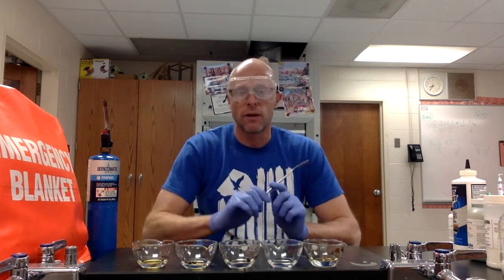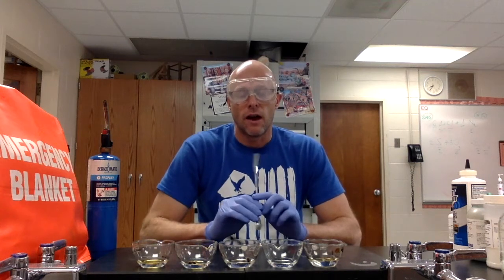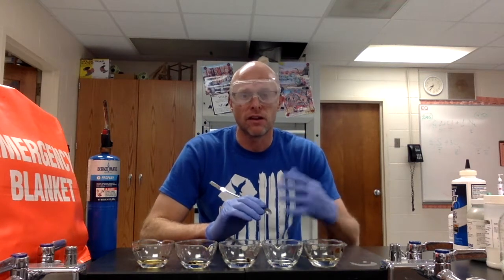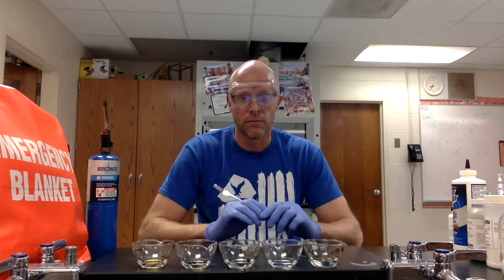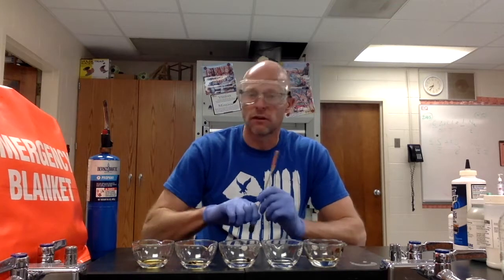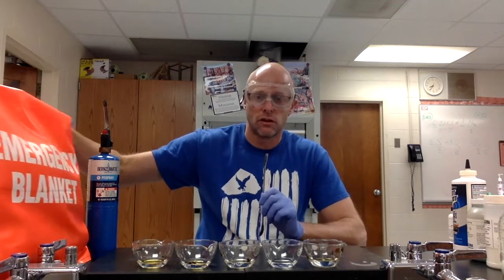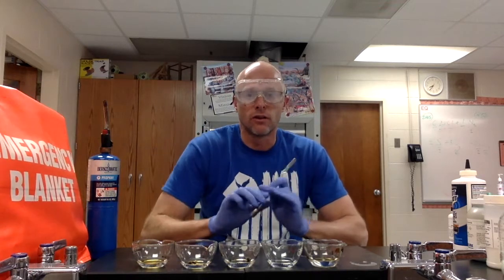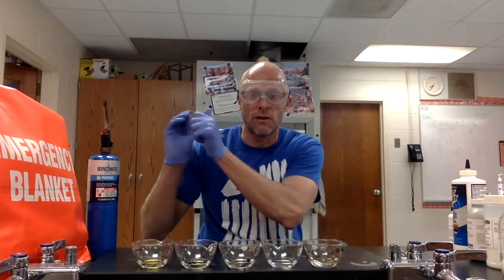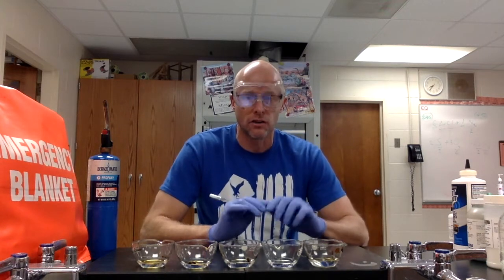Inside each evaporating basin I have methanol. Methanol is highly flammable. I've got my emergency blanket close and the original container that the methanol was in is in my fire cabinet in the back room, so there's no danger there.